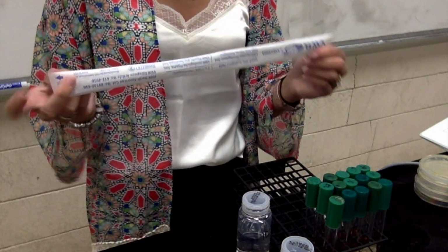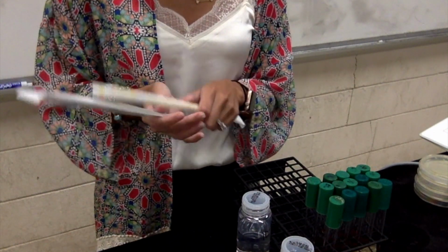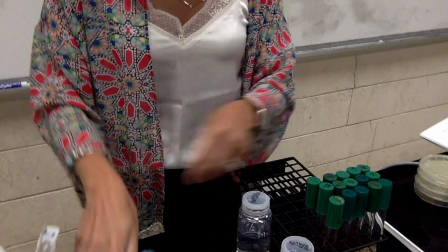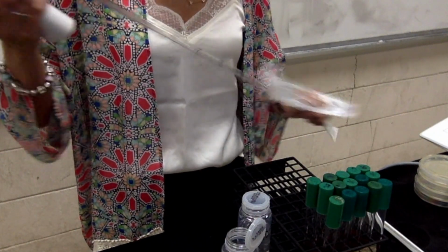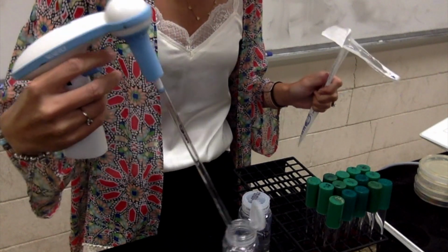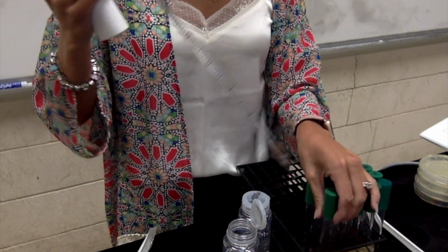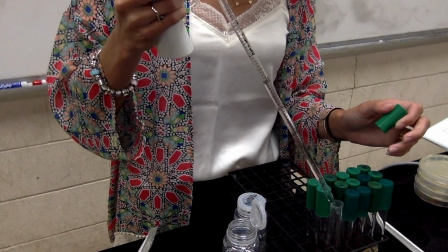And you do this by using your pipettes. So this is a 5 ml pipette, and here's my 1 ml pipette. I'm just going to demonstrate this for you a little bit. I put my sterile pipette in there. I give this a little shake, to make sure we got everything all mixed up. I've got 5 tubes to fill with 1 ml, so I'm going to suck up 5 mLs. And then I'm simply going to get the cap off if I can, and put in 1 ml each.